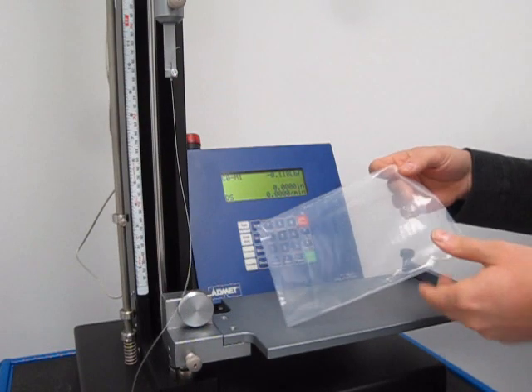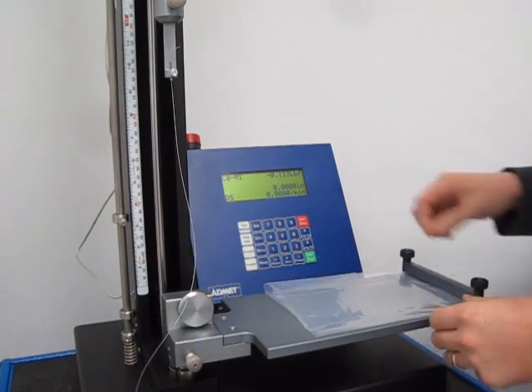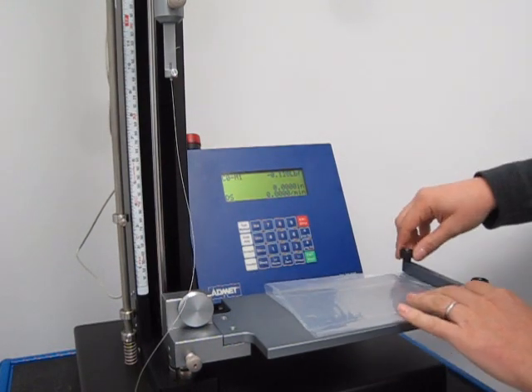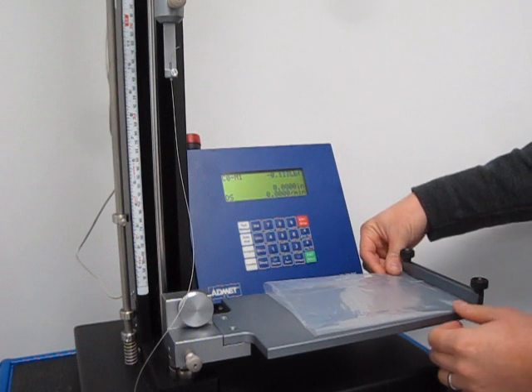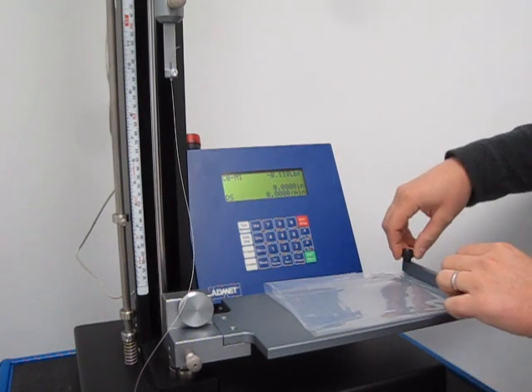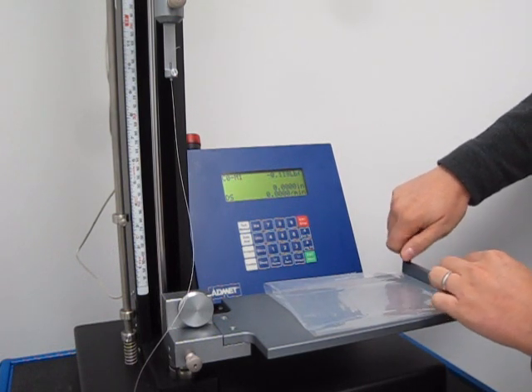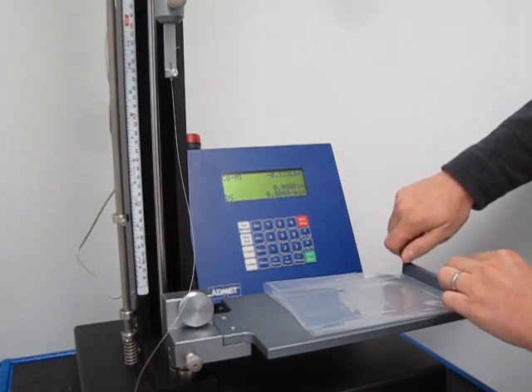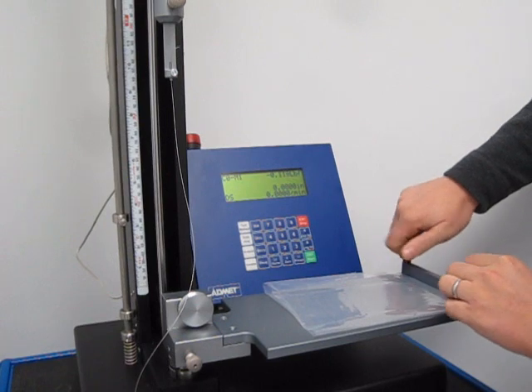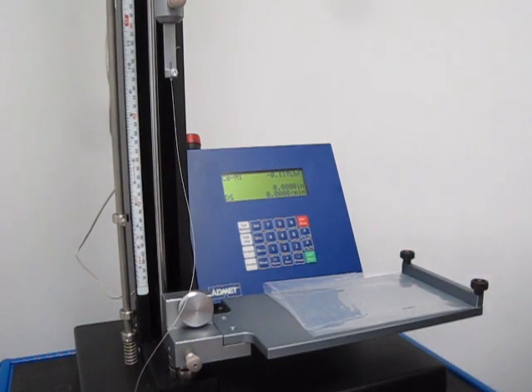We'll take our sample of film and place it in the far end here, then tighten it down with the two bars there.